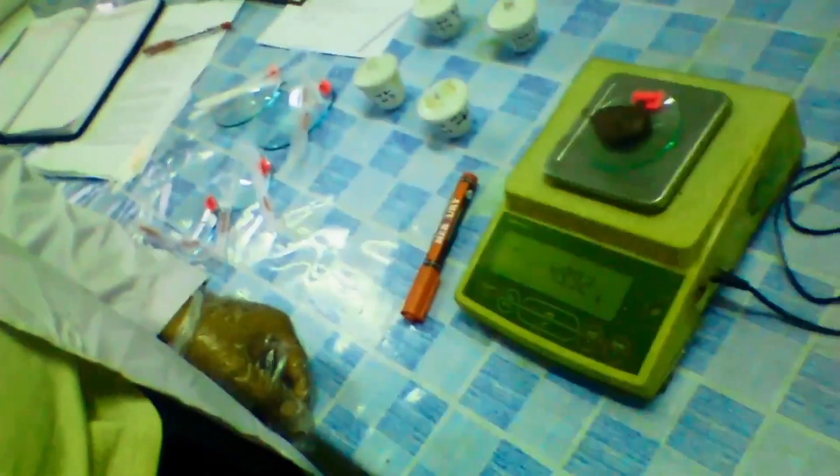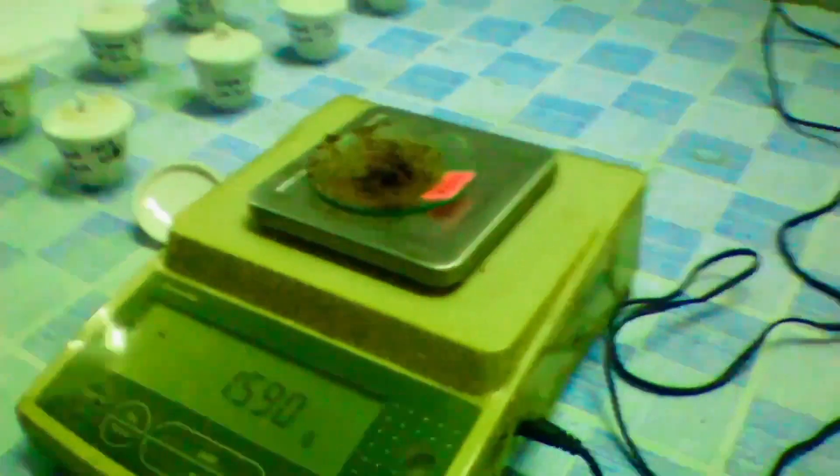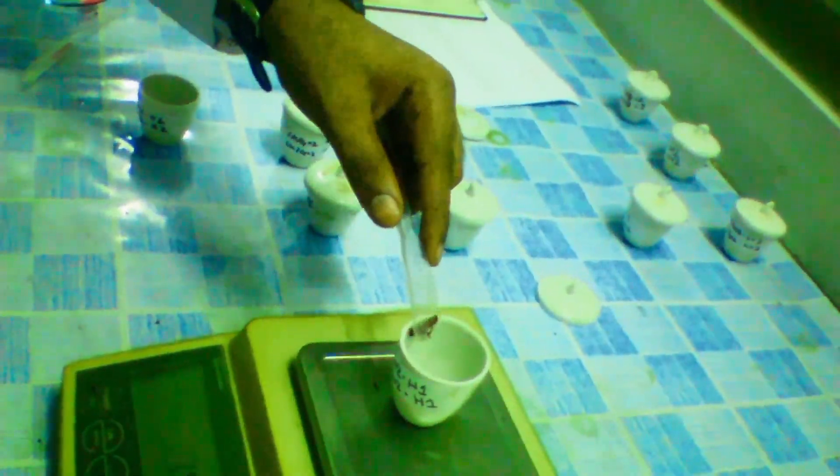You can see that I've been following the process already described here on the digital scale. These are some instruments to cut the tissue into small pieces so they can be used in the process of digestion. Of course you cannot use all the tissue at once — you have to dilute the process, heat the process, and digest it so the heavy metals can be detected. Weigh all the clay pots, tare them, and then the required amount of tissue is added. This gives you the exact weight of the tissue used in the process for acid digestion.